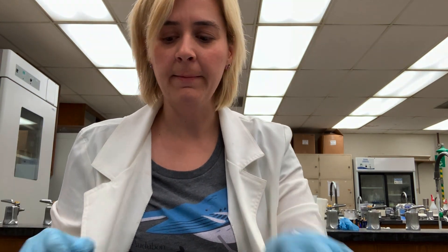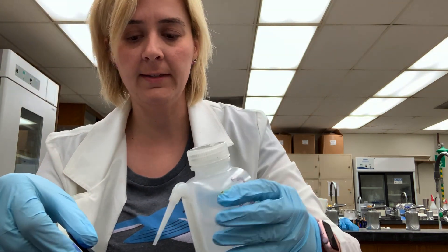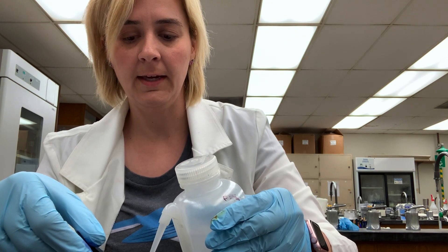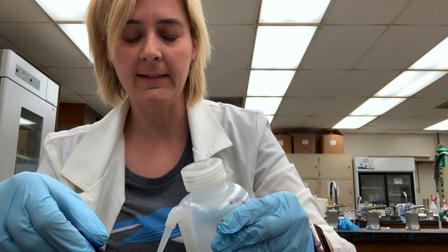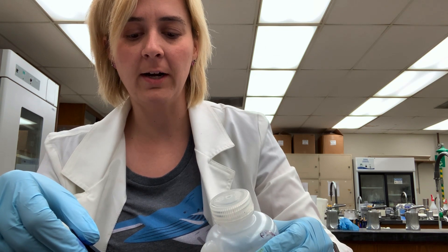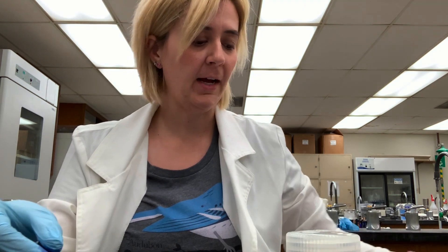After one minute we'll pick up the slide and rinse with water. What we're hoping to see is that all normal cells with no mycolic acids will be blue from the methylene blue, whereas our mycobacterium, which has mycolic acids, should be pink from the carbolfuchsin. We'll let it dry and take a look under the scope.